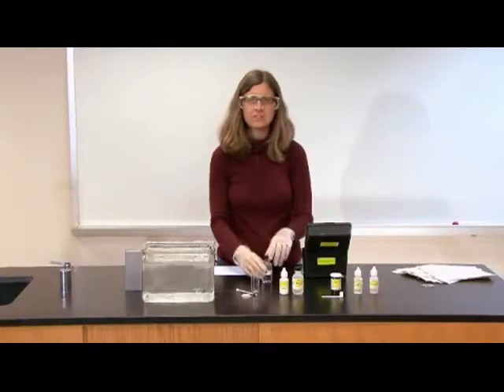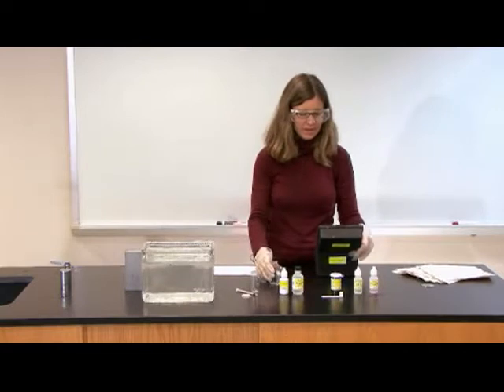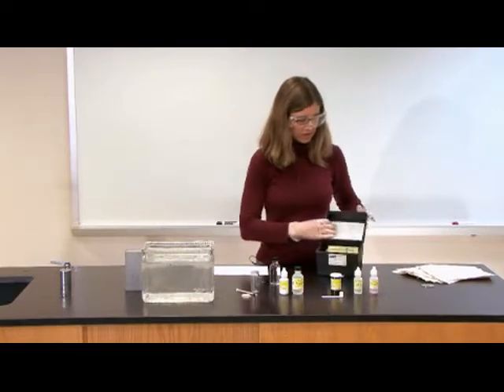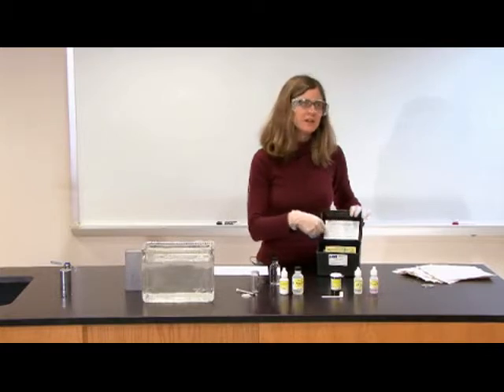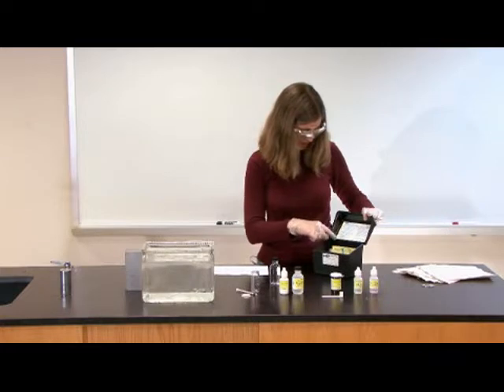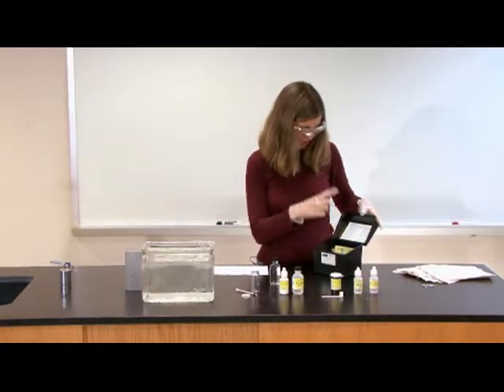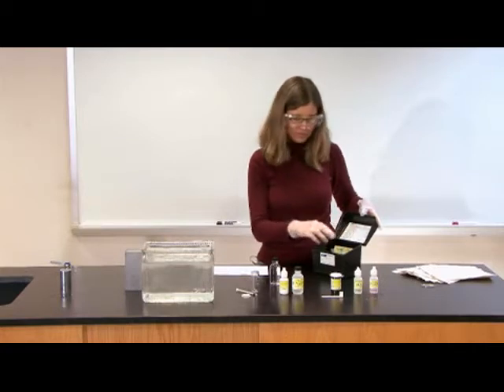Once you've collected your water sample, you want to dry off your hands, and then the directions for conducting the dissolved oxygen test are actually just on the inside of the test kit, so it's very convenient. It describes the sampling method that I just went over. Then there's two additional major phases: sample preservation and then the test procedure.